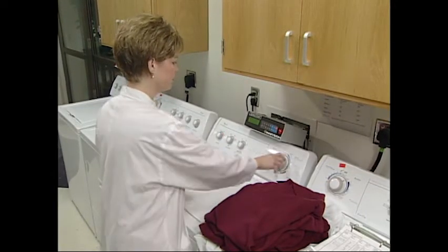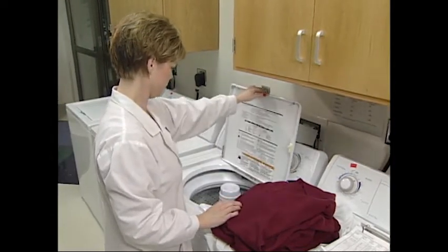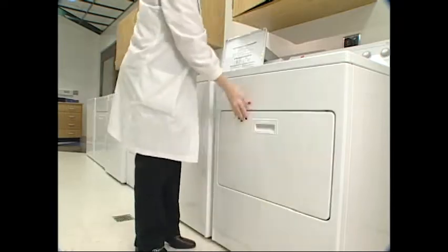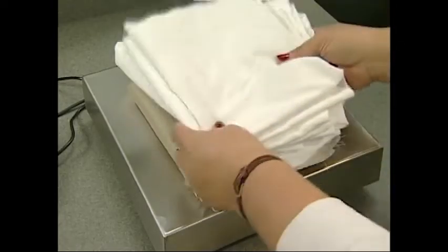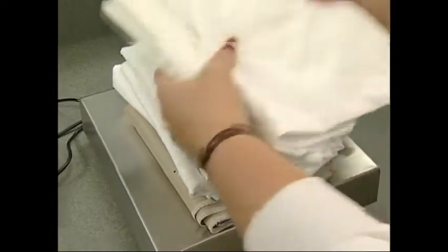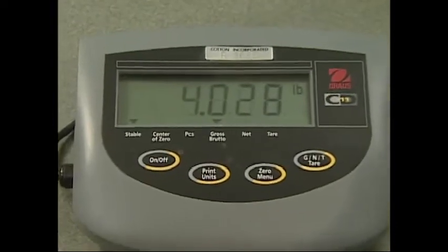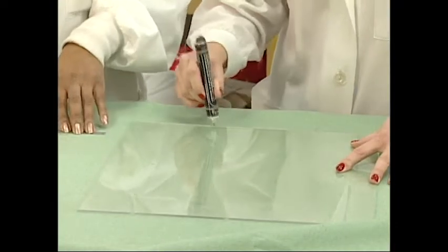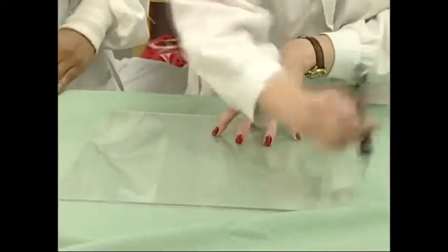The materials and equipment needed for these tests include the following: an automated washing machine, an automated tumble drying machine, standard laundry detergent, ballast cloth and weighing balance or scale, an indelible ink marking pen, a 15 inch by 15 inch template cutting guide, and a ruler or measuring system that yields direct shrinkage numbers.